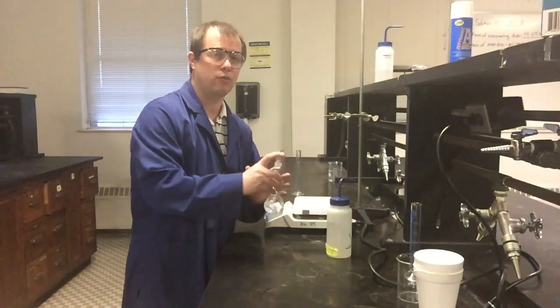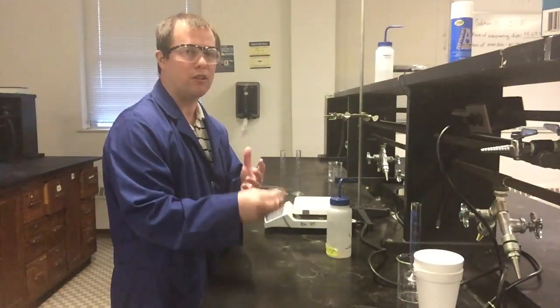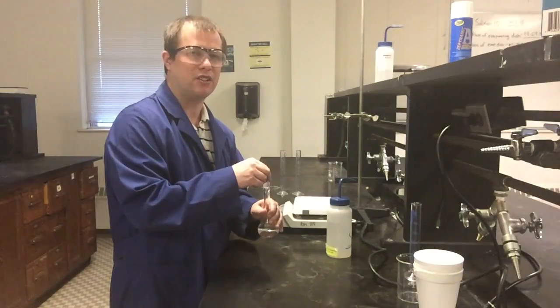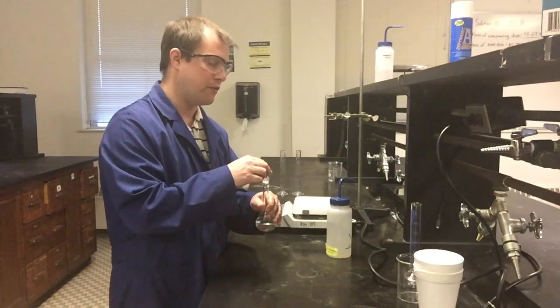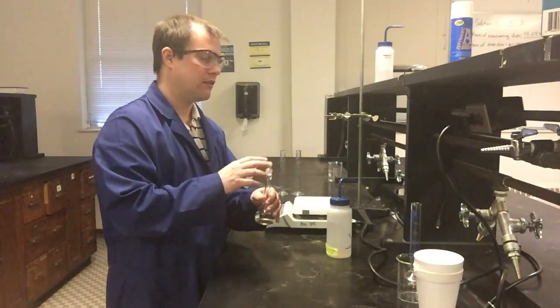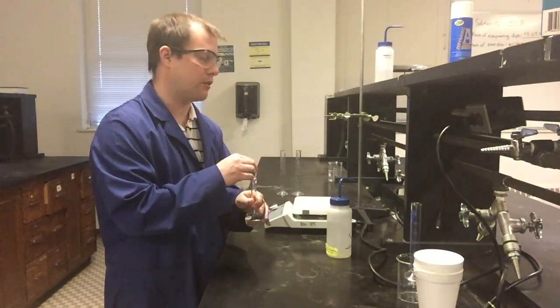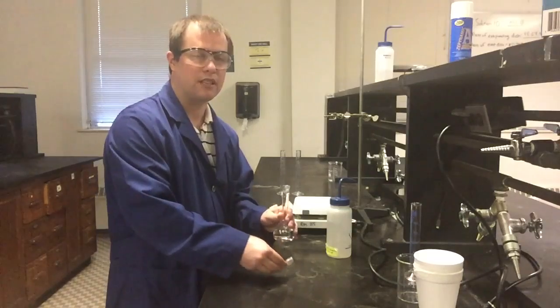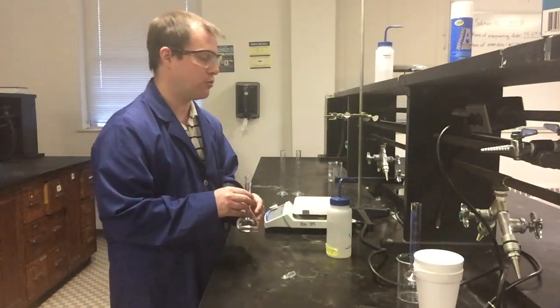HCl at a concentration of 1 molar, thankfully, which this probably isn't quite that dilute yet, even at 1 or 2 molar, it's a low enough concentration that it's not going to do severe damage, but you will probably feel a tingling sensation, and you'll want to wash it off immediately. Again, if you're a little more afraid of any of these chemicals, or if you're just not comfortable handling everything glassware-wise, I do encourage wearing gloves for things like this until you have a little more lab experience and become more comfortable.